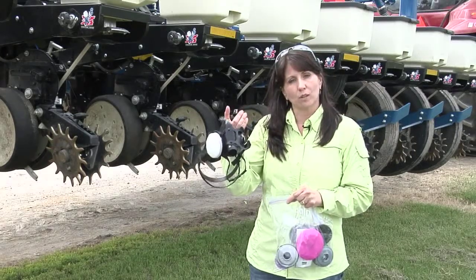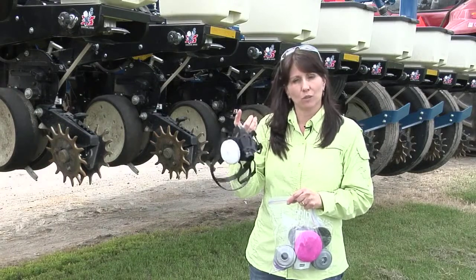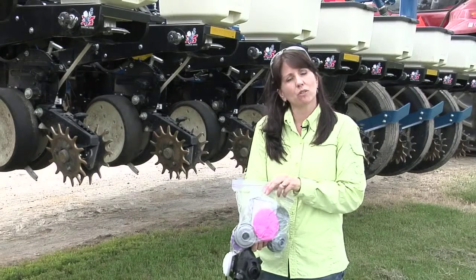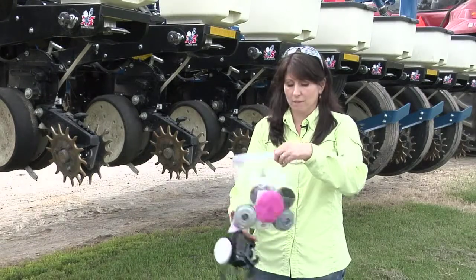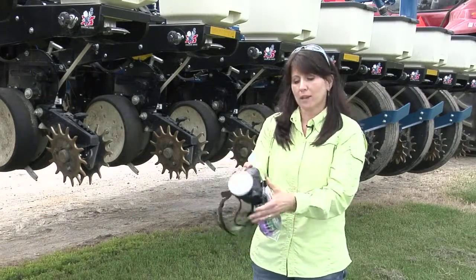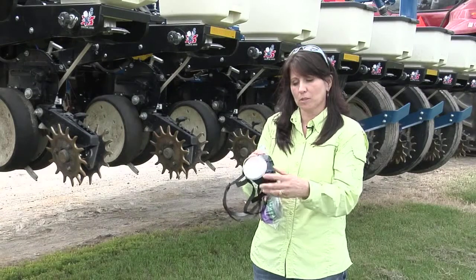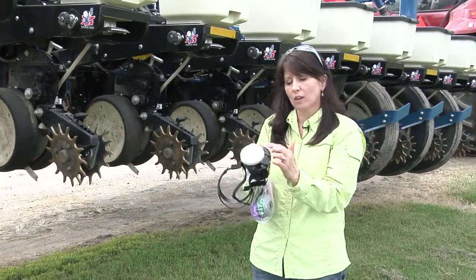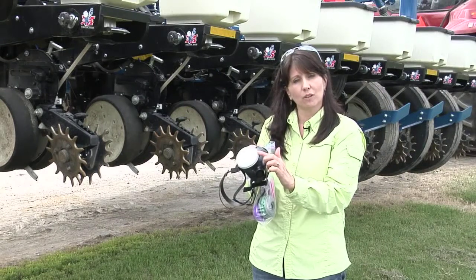This is a cumbersome looking respirator that some people are unclear how to use. There are various different types of cartridges, and we want to make sure you're not using ones you really don't need. This type of mask, for most all intensive purposes, only needs something very lightweight — a pre-filter, a filter holder, and a filter cover.